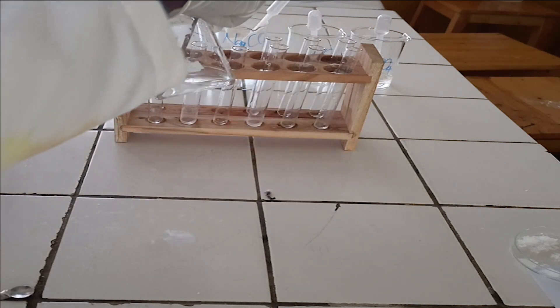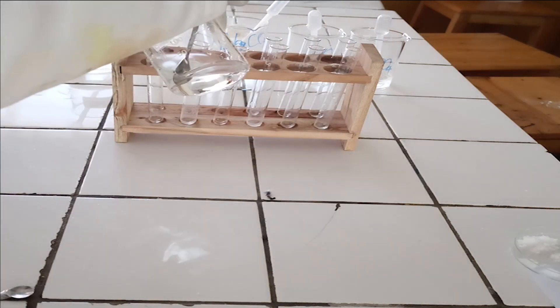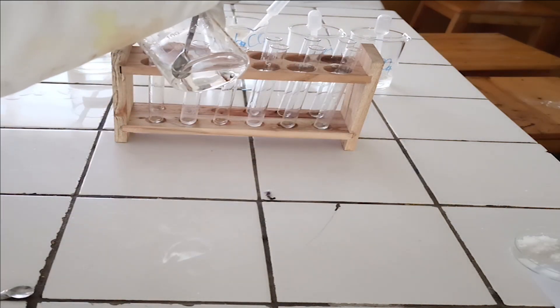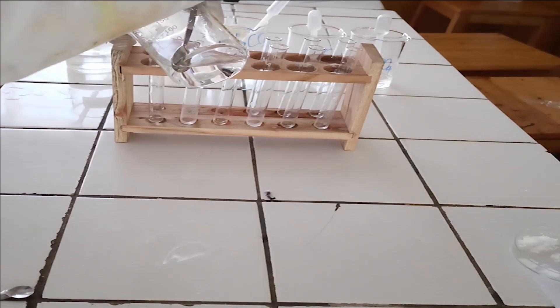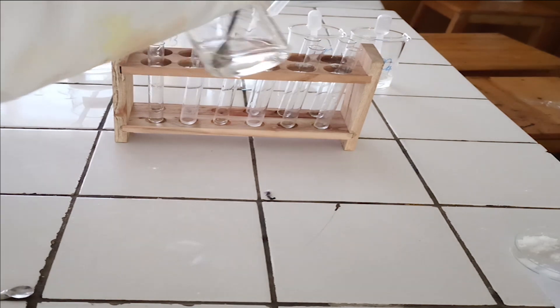Divide the solution into test tubes. Put around 5 milliliters in each test tube.